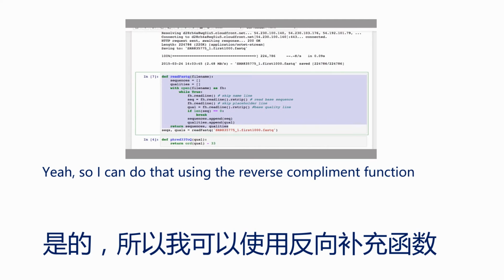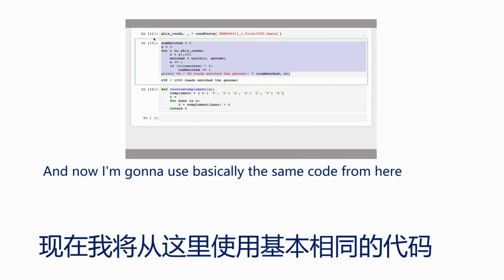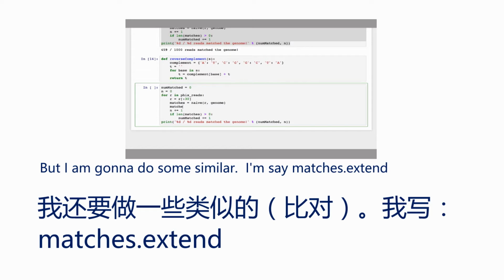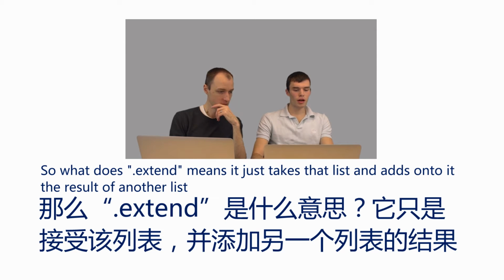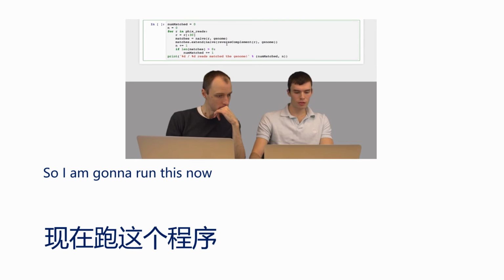Yeah, so I can do that using the reverse complement function, which we developed in Practical 2. So I'm just going to paste this in here. And now I'm going to use basically the same code from up here, but I'm going to do 2 steps here. So I'm setting matches to be the naive exact match between R and the genome. But I'm going to do something similar. I'm going to say matches.extend with naive of the reverse complement of R and the genome. What .extend means is it just takes that list and adds onto it the results of another list. So the first line here, matches equals naive of R in the genome, is going to test whether that read matches in the forward direction of the genome. In the next line, we'll add onto it the results of any matches of that read to the reverse complement of the genome. So I'm going to run this now.